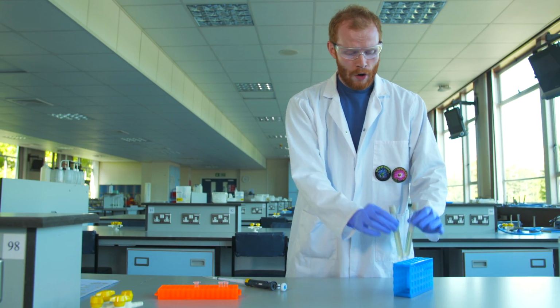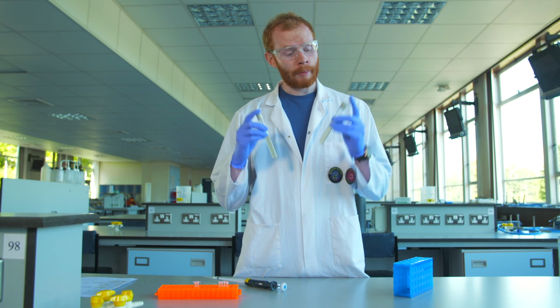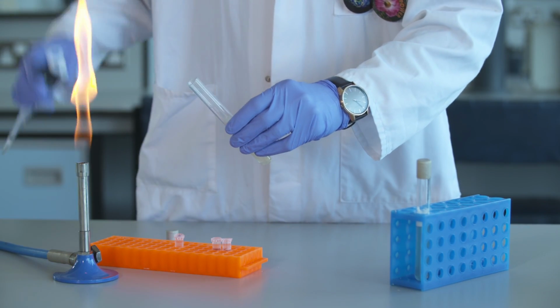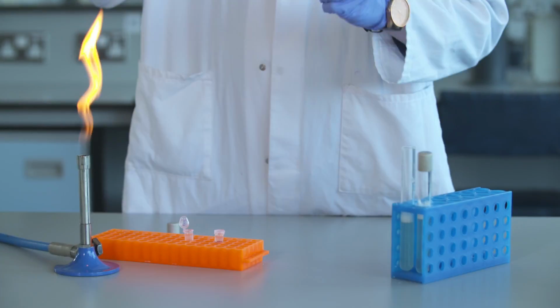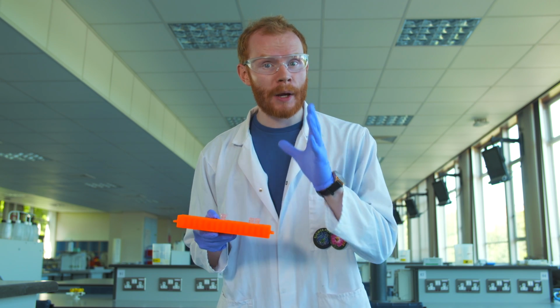Here I have two bacterial cell cultures, one with a mutation that affects membrane permeability and one without. To each of these cultures, I'm going to add a fluorescent chemical which should be excluded from the cytoplasm of bacteria with an intact cellular membrane. Once we've added our reagents, it's time to go and qualitatively analyze our bacteria under a special microscope.